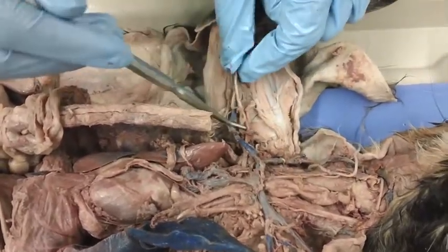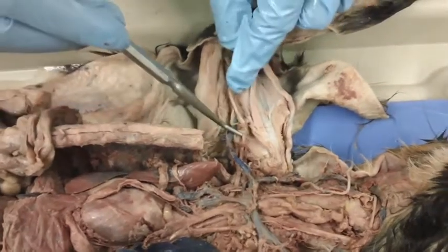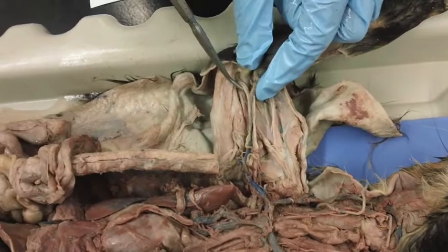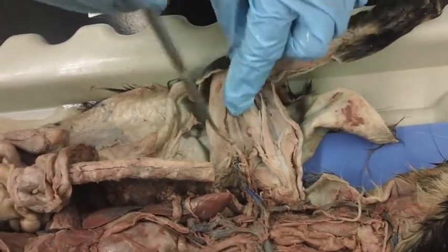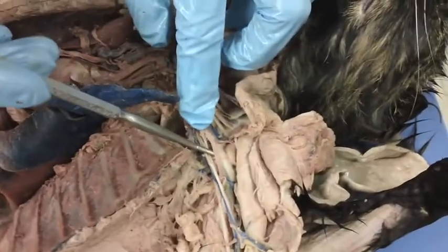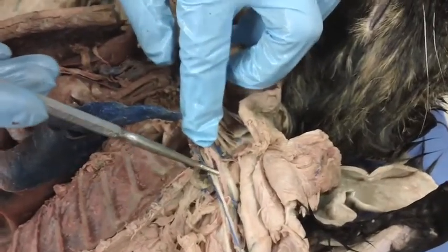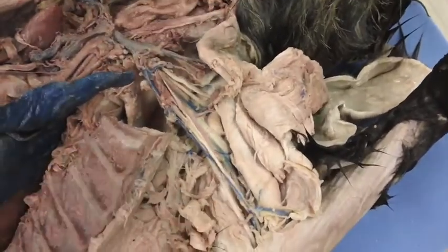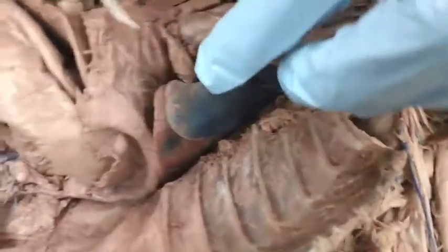In the axillary area, it's going to be called the right axillary artery, and then it'll transition into the right brachial artery. It's kind of hard to see on this cat. You can see on the left side. So this would be the left axillary artery, and then the left brachial artery. Okay, and then we have the heart.